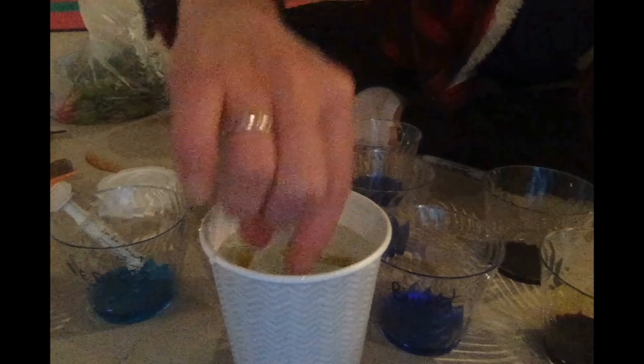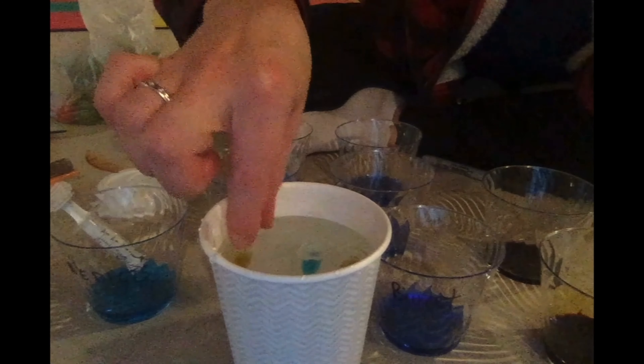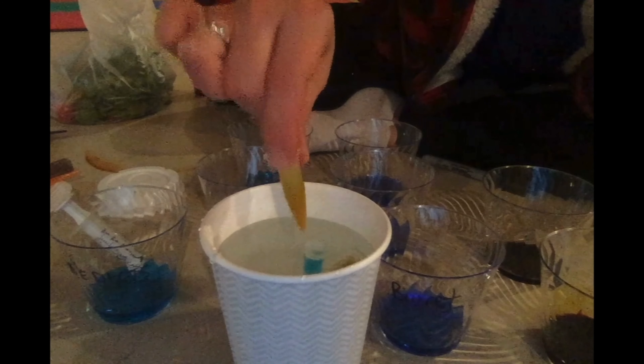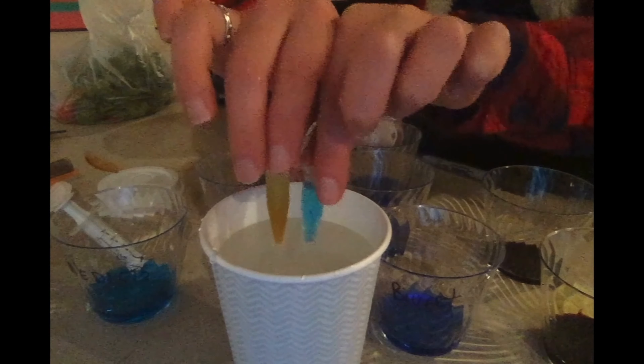You can see it's just bobbing up and down — here's the one I just put in. You have to wait about five or six minutes, and when they're done they should look like this. This would be a positive result — you can see clearly there was a color change after about five or six minutes.